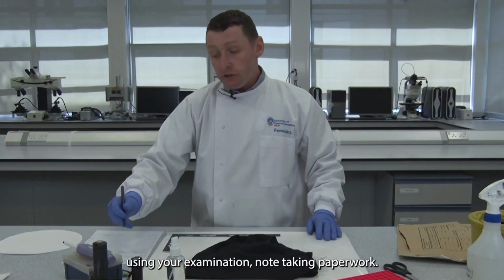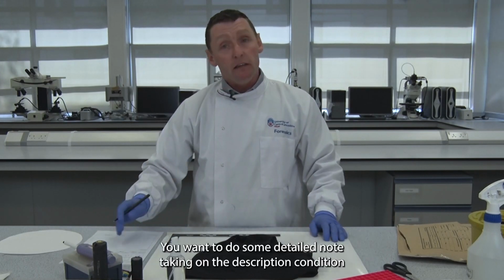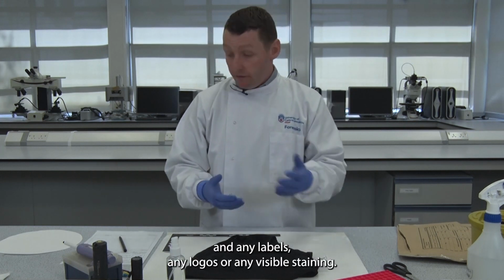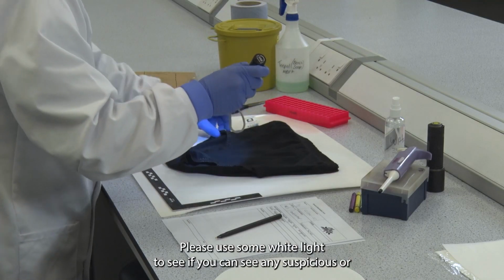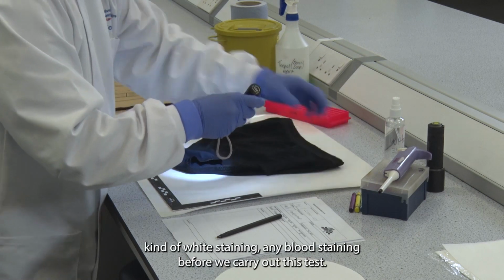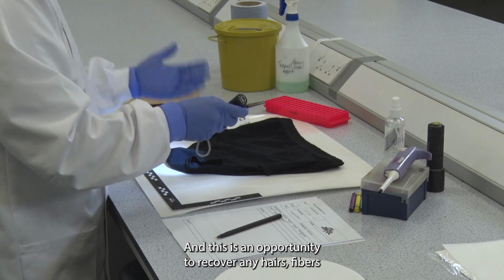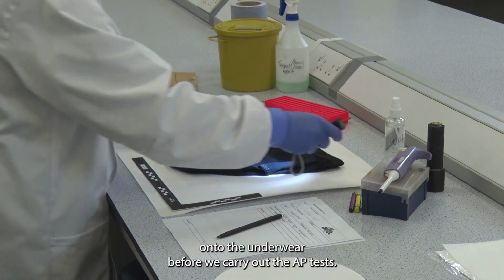Using your examination note-taking paperwork, you want to do some detailed note-taking on the description, condition, and any labels, logos, or visible staining. Please use some white light to see if you can see any suspicious white staining or any blood staining before we carry out this test. This is also an opportunity to recover any hairs or fibres from the underwear before we carry out the AP test.